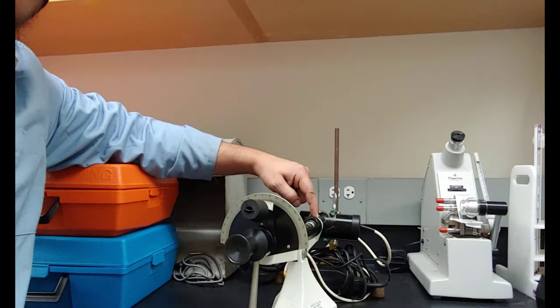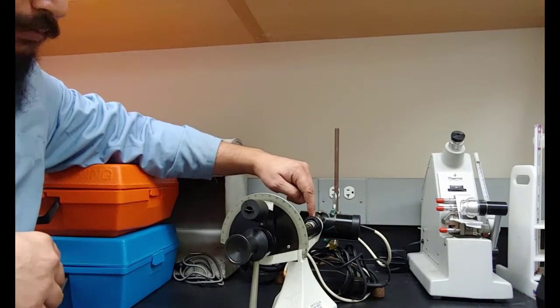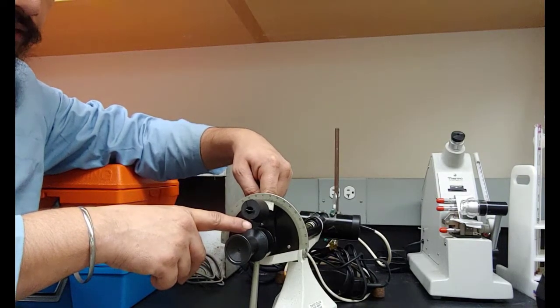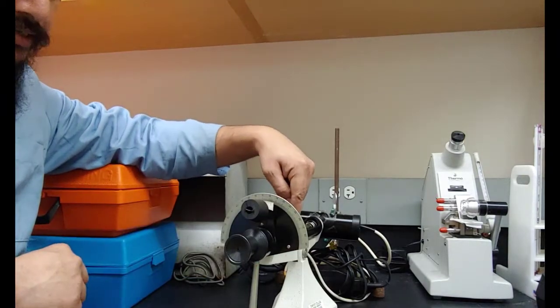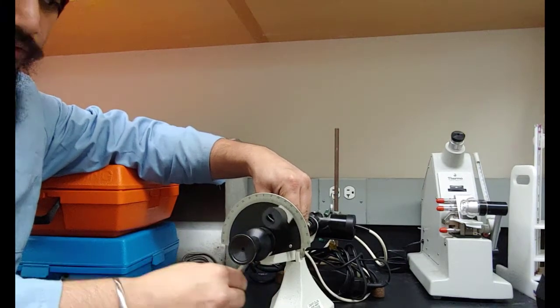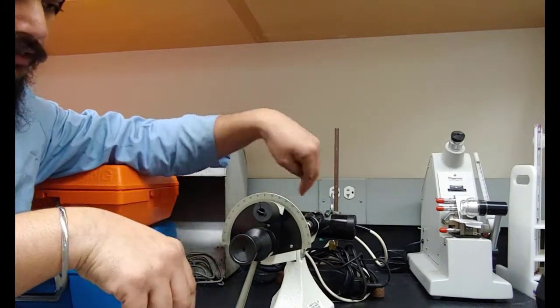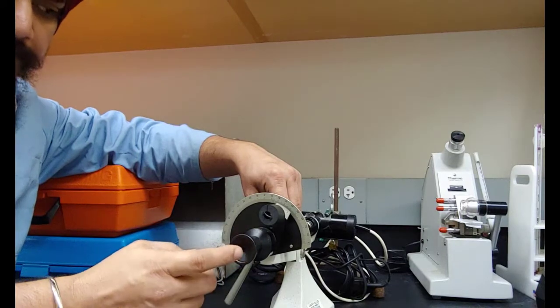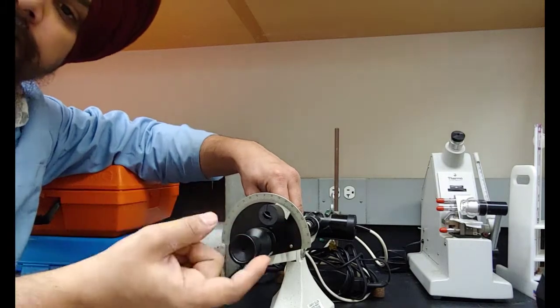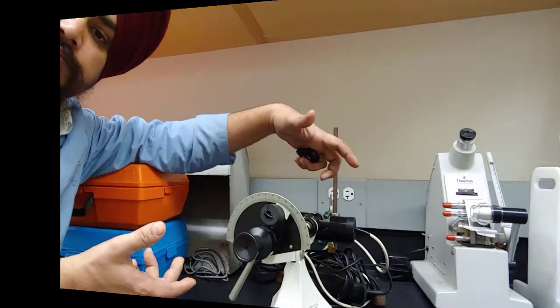The polarizer on this end cuts down all the light in different planes, and only one plane polarized light passes through it. And then there's another polarizer here, and if the molecule rotates a light to any direction, we have to match this rotation with this rotating device. And once the plane is matched, then we see the full intensity here, and we will note down from this scale how many degrees it rotated. So this was the old way of measuring the polarization.